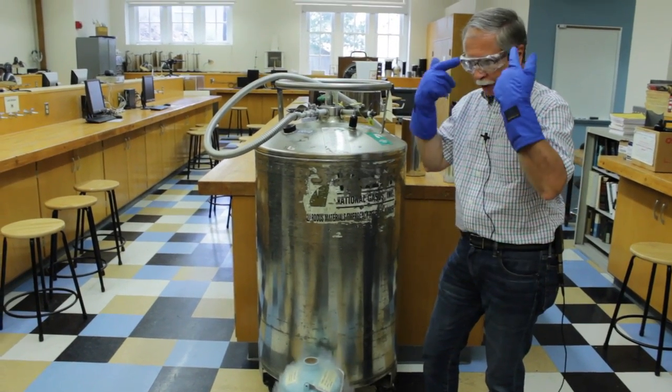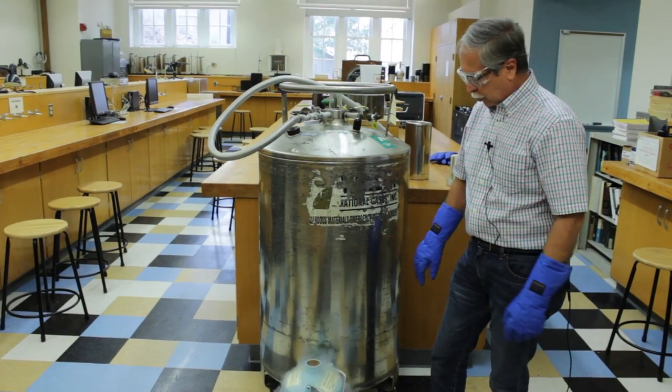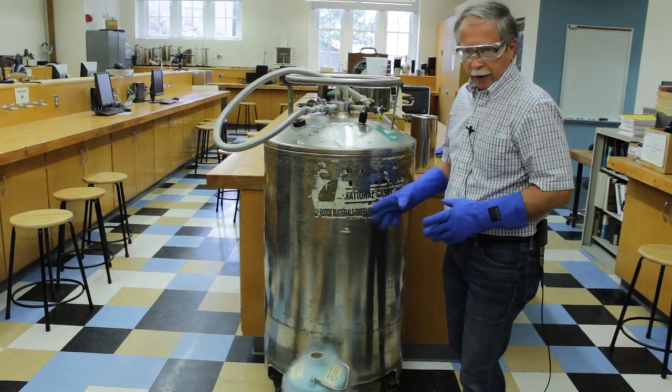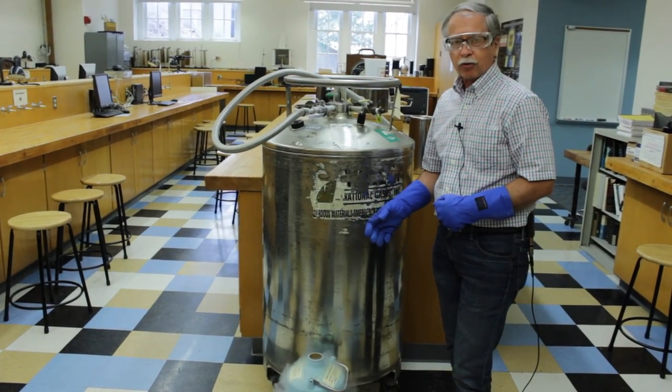So you see I'm wearing some safety goggles and low-temperature gloves. What we'll do, the students will not actually dispense the liquid nitrogen themselves.